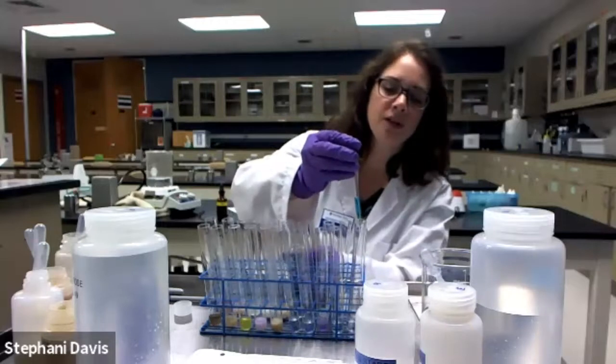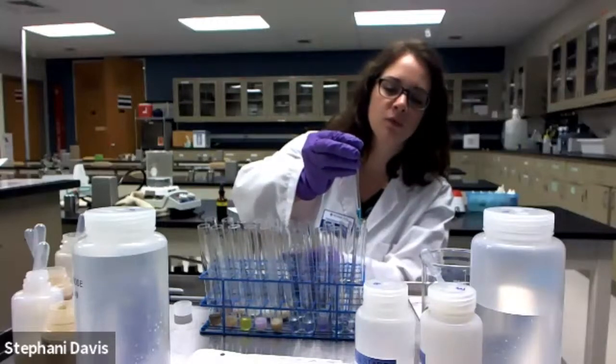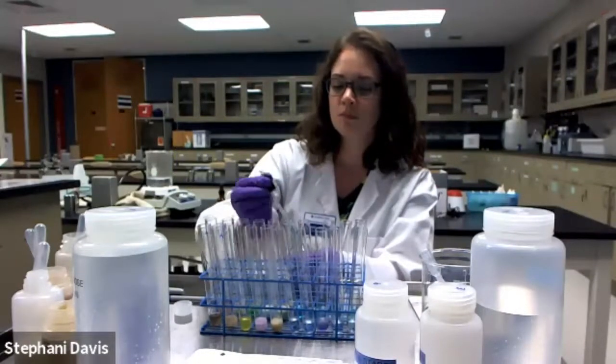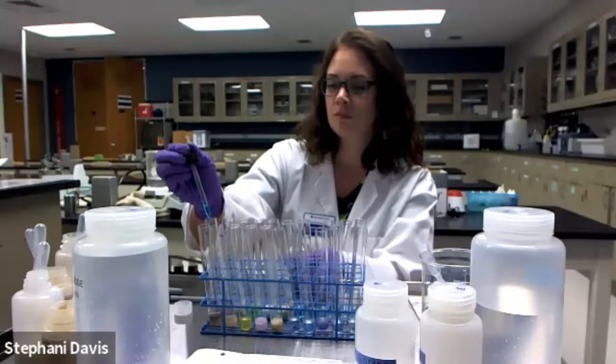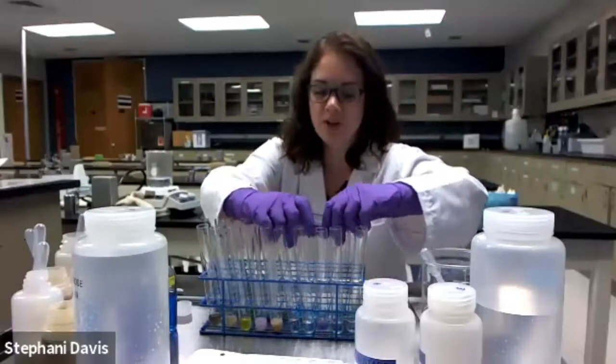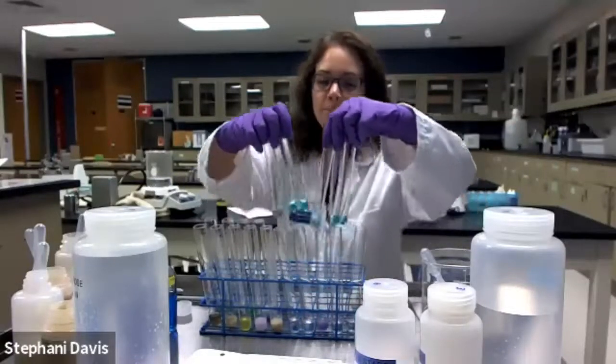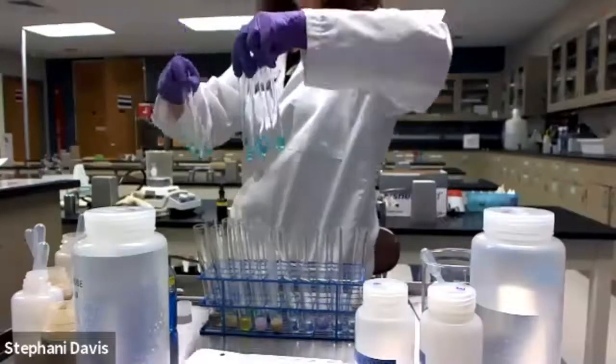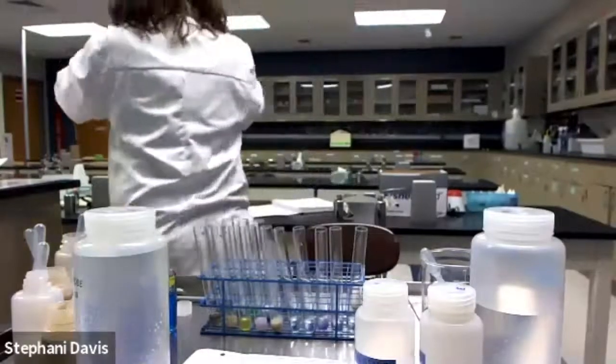And then during that time, we'll take a look at our results for the Biuret test. Right behind me, I have a hot water bath. It's not quite boiling, but we'll get it up there. Just gonna gently give these a swirl and then place them in there.